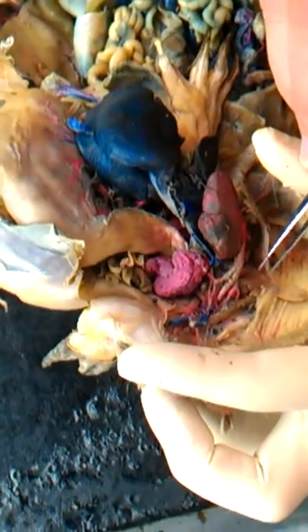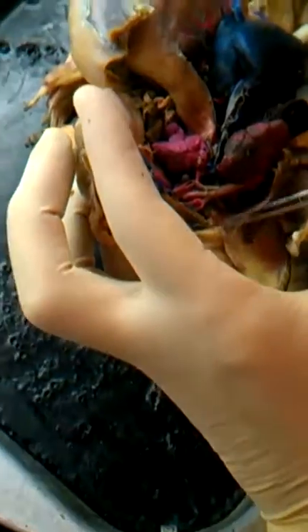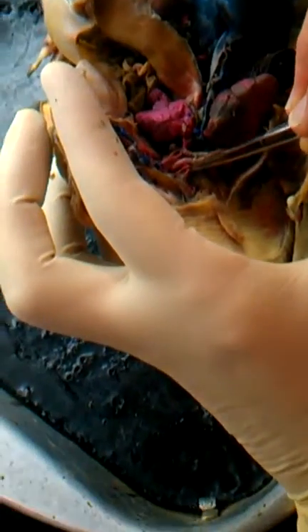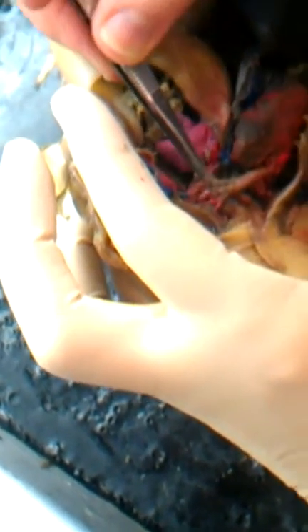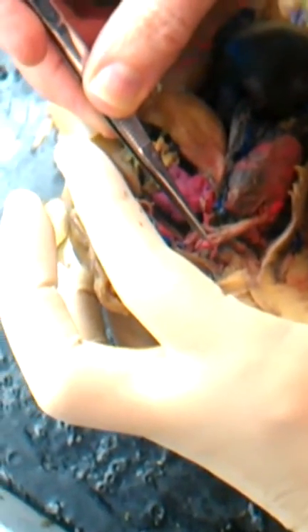It has 2 blood vessels you have to know. The external carotid artery is this one, going up underneath the mylohyoid muscle, so it's a little more superficial. Sometimes we can see the thyroid gland next to it, and I think that's it right here. It's a little bit mashed on this one, but it's a brownish or pinkish lump. The other direction here is the internal carotid artery, and that one's easily distinguishable because of this bulb-like structure, which is called the carotid body or carotid gland. I can't remember what term we used for you guys. Gland. Yeah. It's the same thing.